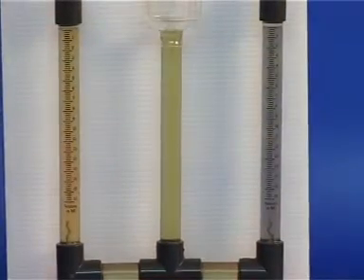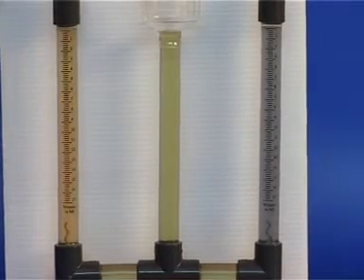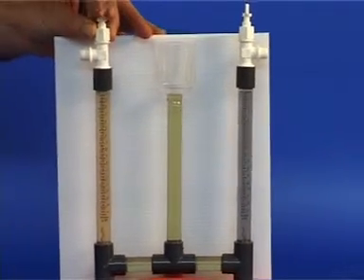The reaction commences immediately when we connect both batteries and bubbles appear at both electrodes. Now, close the two valves.